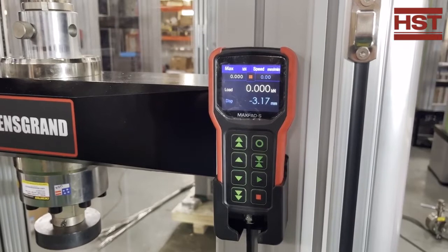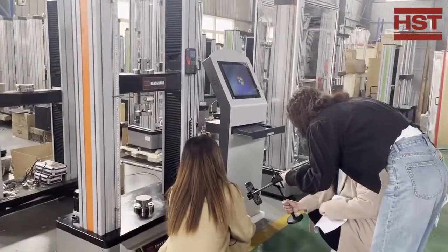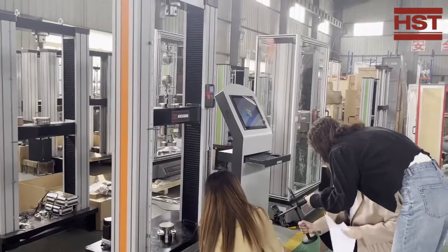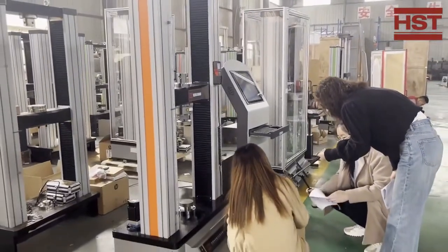It can also set to zero and start or stop the machine. It can also choose the speed of the middle beam moving up or down. Once you start the machine, this is the power-on button. On the right of it is an emergency button — if you need to immediately stop or shut down the machine, you press that button.